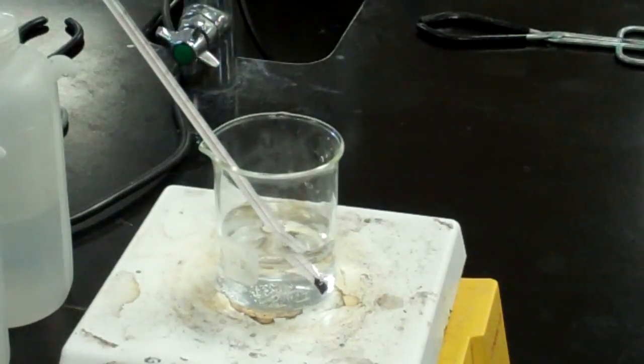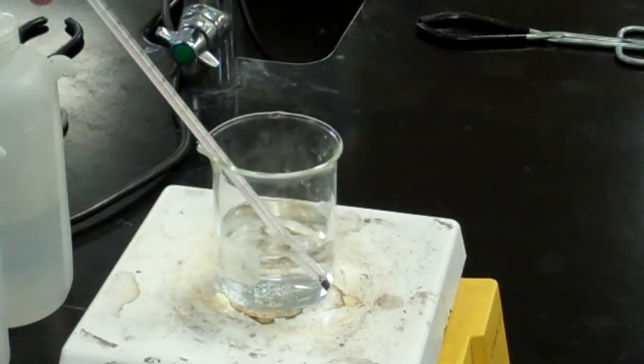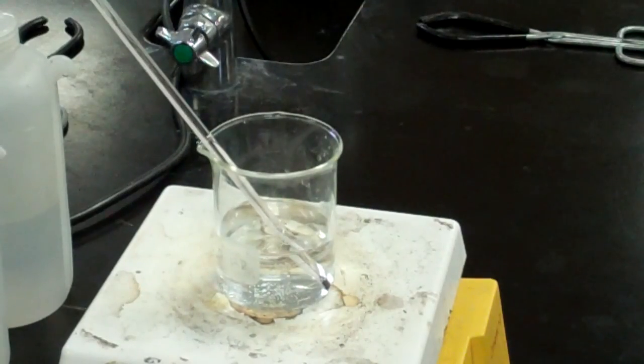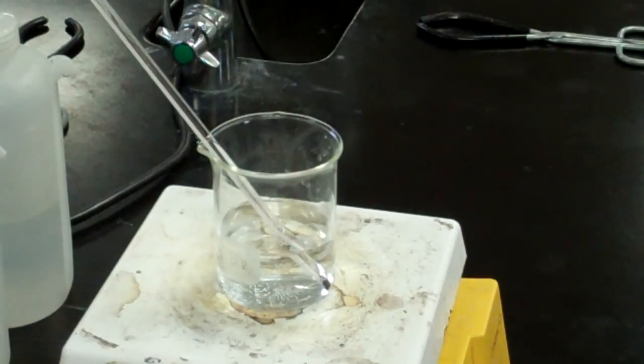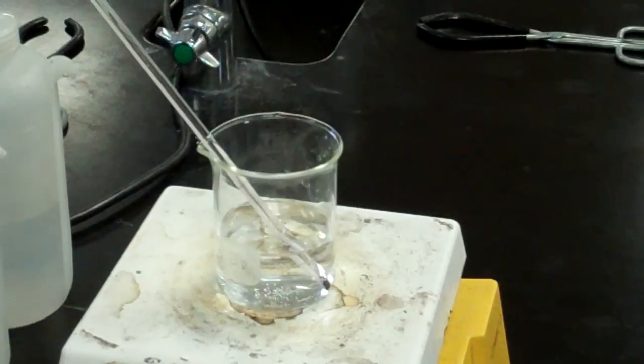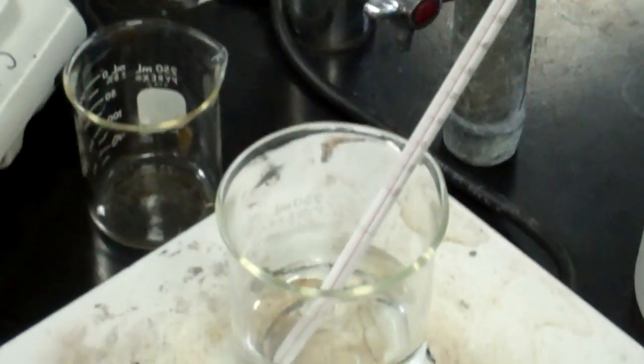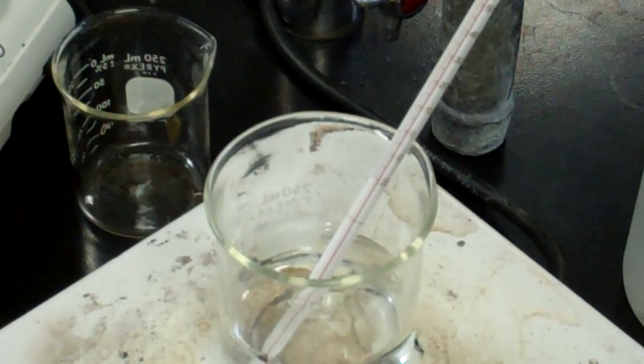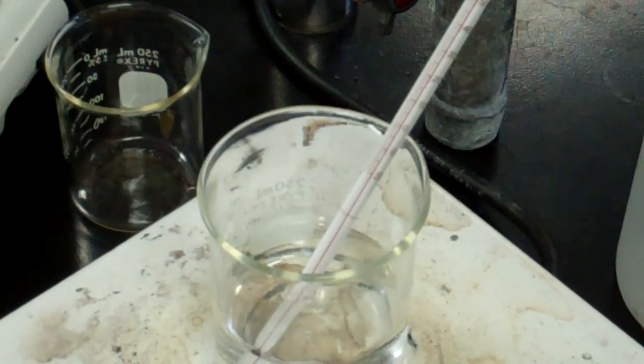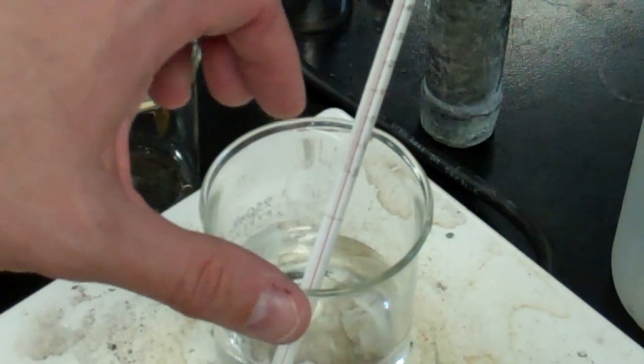Alrighty, let's see. We'll stop this. We're at about 85 degrees Celsius and it's rising. Let's see how long this video is so far. Well, it's about six and a half minutes. Maybe we could bring this over and we could record a final boiling point and get our delta T. Let's see what happens here. Maybe we'll listen to a little bit of Zac Brown in the background while that's happening.